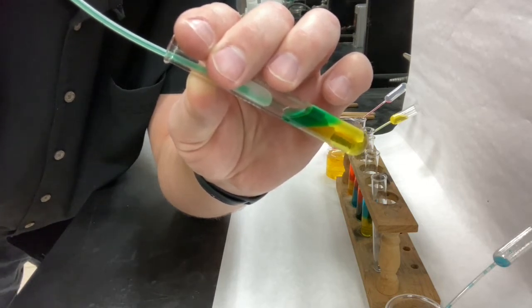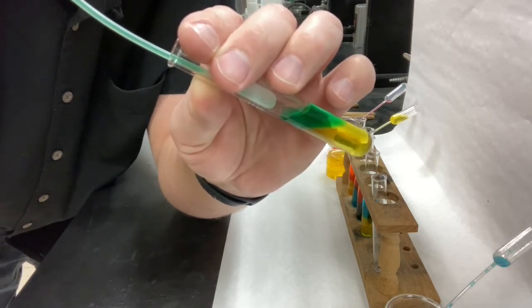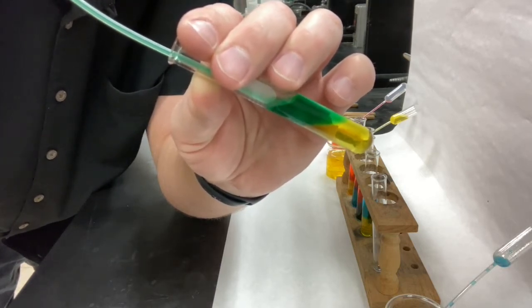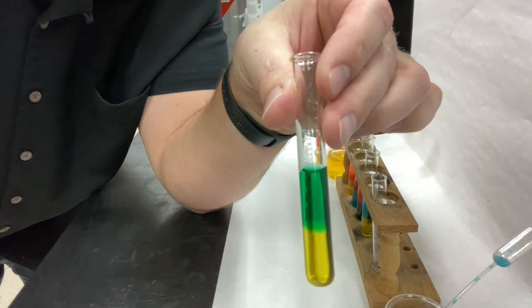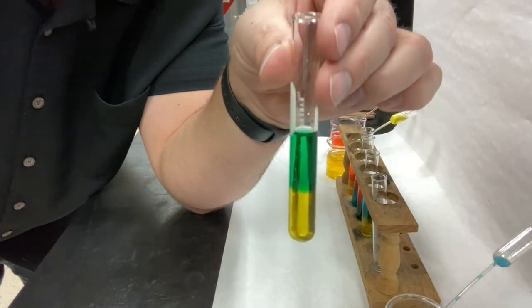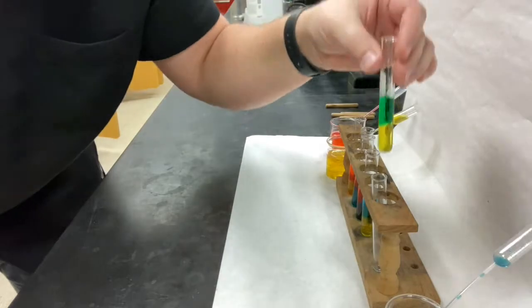So it's interesting because sometimes when I add a liquid, you can see it kind of run right down the bottom of the test tube and collect at the bottom and push the other liquid up. But sometimes the liquid I'm adding just rests on top. That's obviously because they're different densities. So make notes in your data table, and all while we're thinking which of these two liquids is more dense and which is less dense.